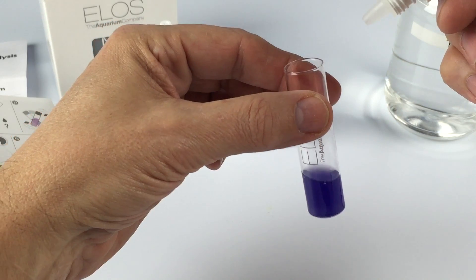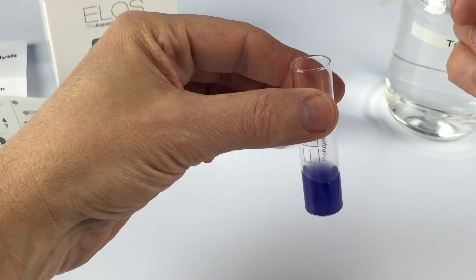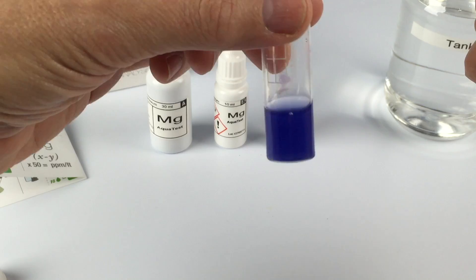I want to make sure the solution stays blue for at least 20 seconds so I know that the color change is complete.